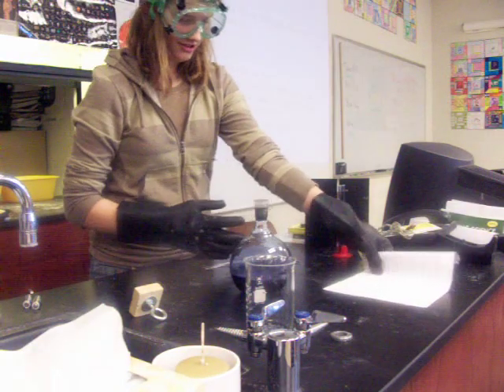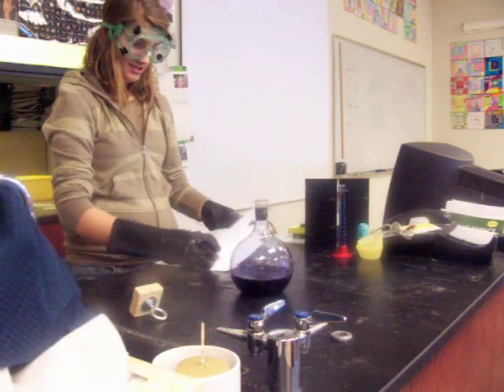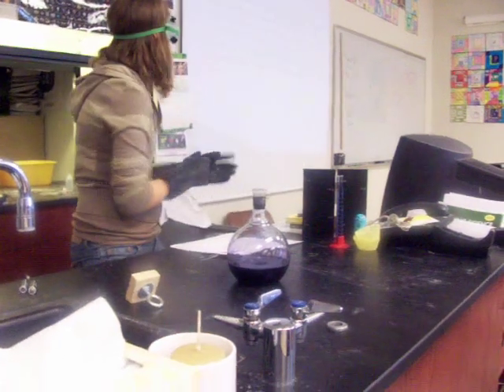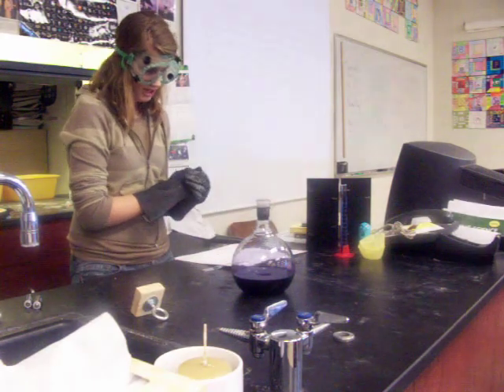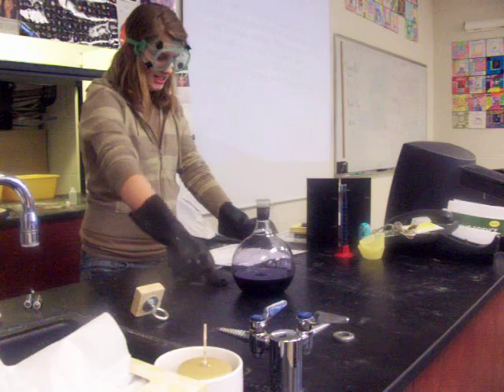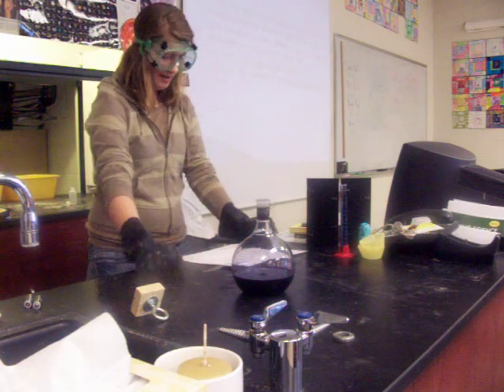We're going to go through explaining part of it while we wait for it to react. As you will see shortly, when shaking the bottle of chemicals, the color changes to blue. And as you let it sit, the bottle is going to turn back to a clear color. And why does this happen?